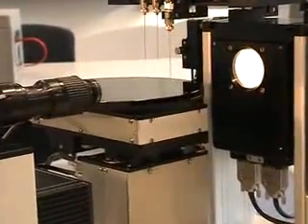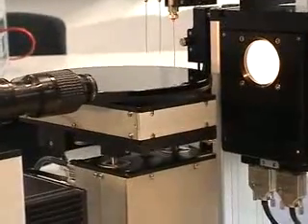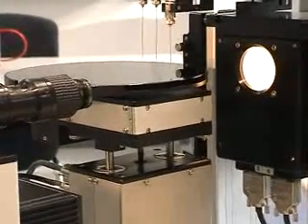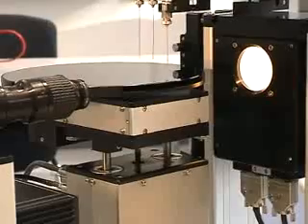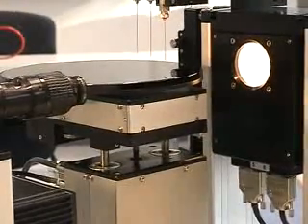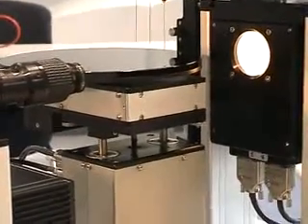Sample stage and needles are moving automatically. We can position now the droplets and the measurement is performed.